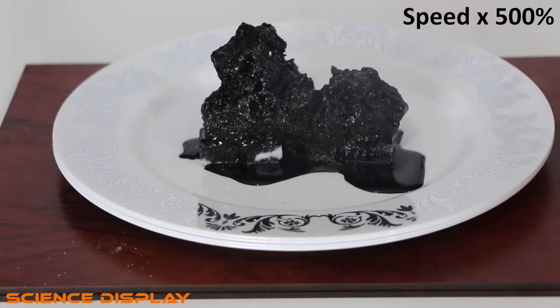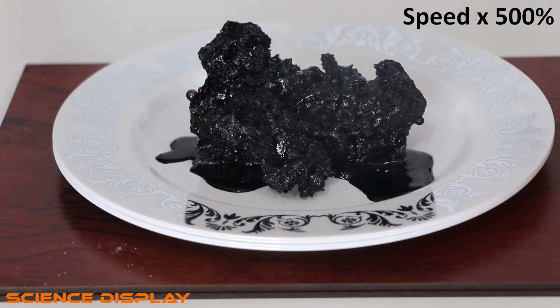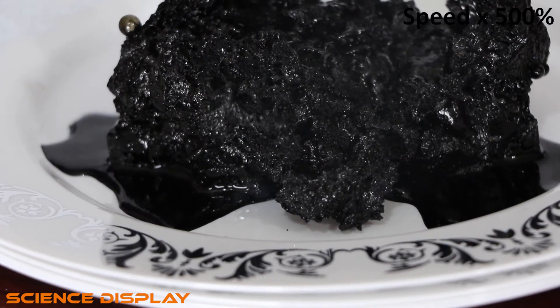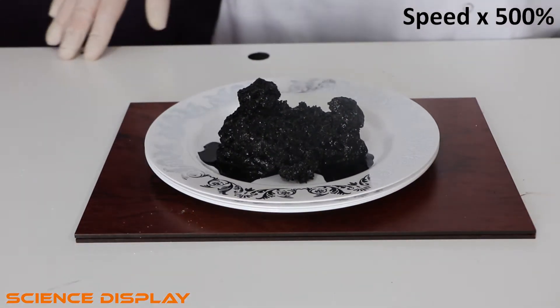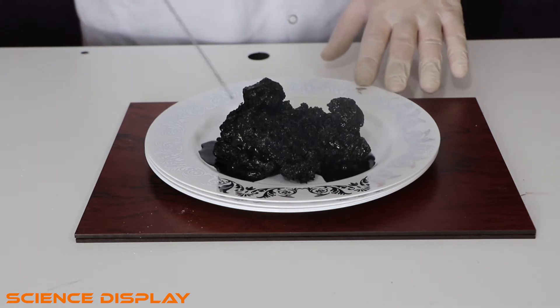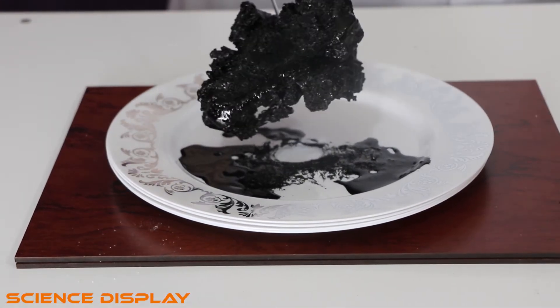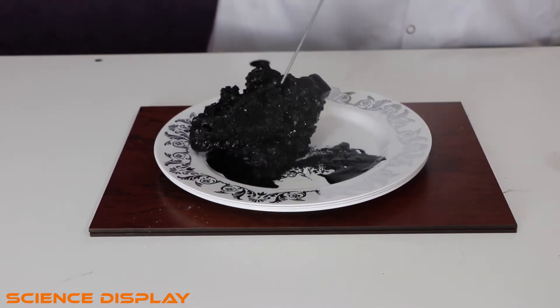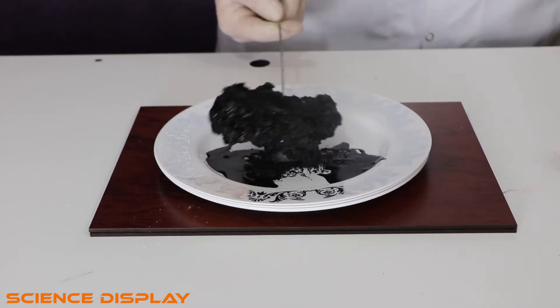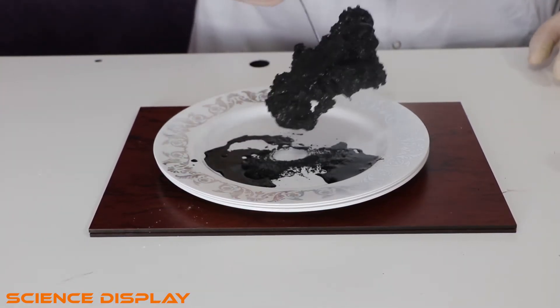Let's check the inside of it. Look at that — all the sugars! They didn't just decompose, all the sugars reacted with the sulfuric acid. Their shape changed completely and it's smelling very bad. Really a different kind of shape.